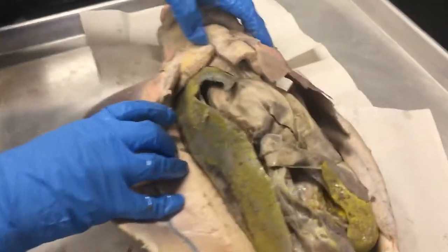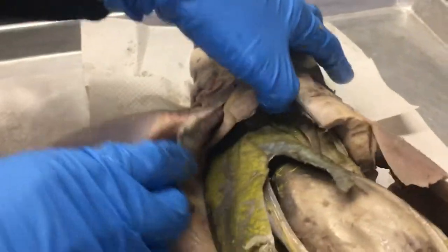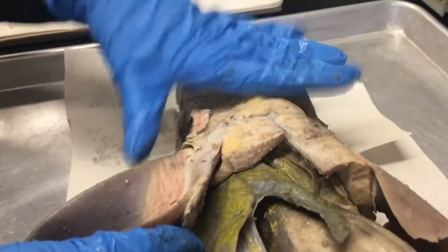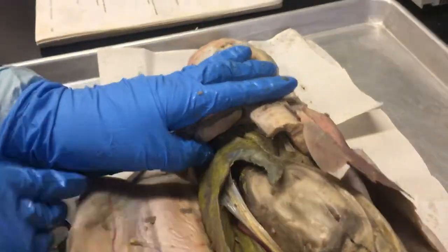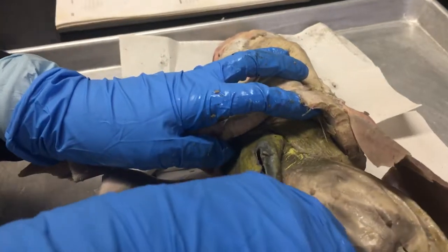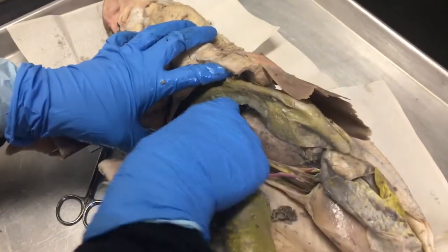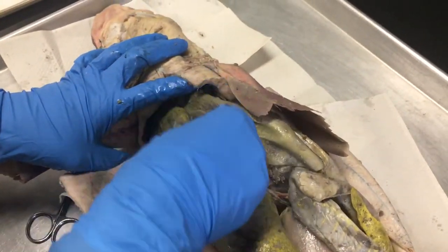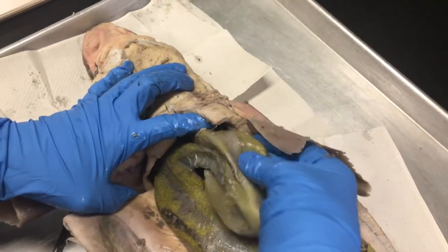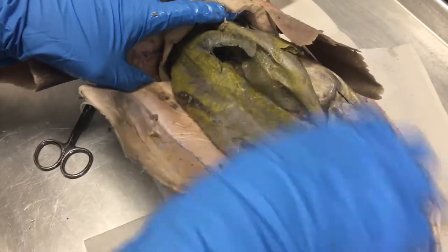This is the transverse septum area, which separates the cardiac and thoracic area from the digestive tract. It is mainly separated by where the liver is, and this whole structure is the entire liver. You have your right lobe, your median or medial lobe, and your left lobe. The liver is going to be the largest organ in the body.